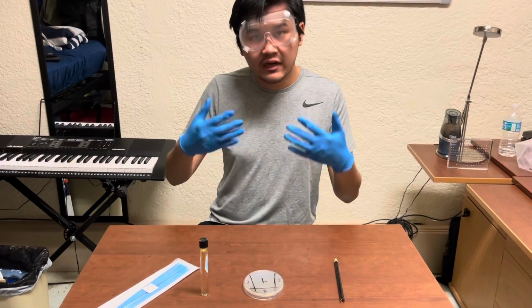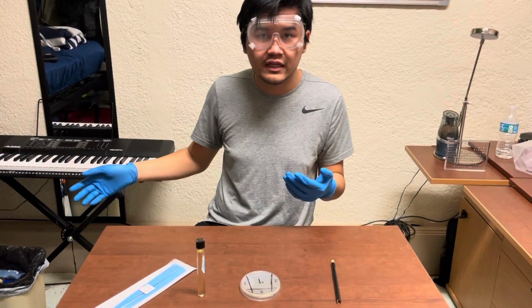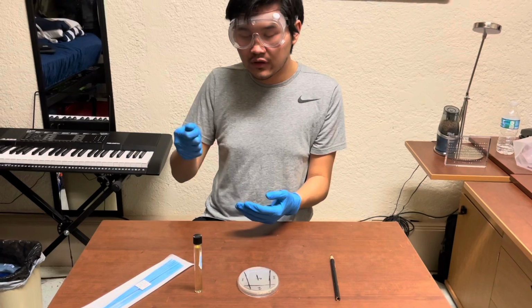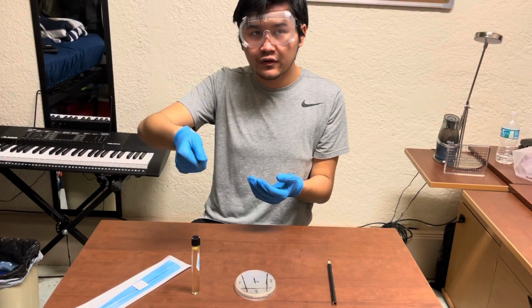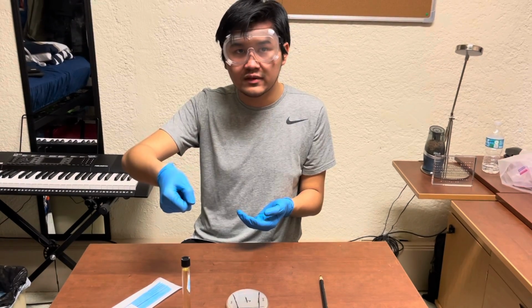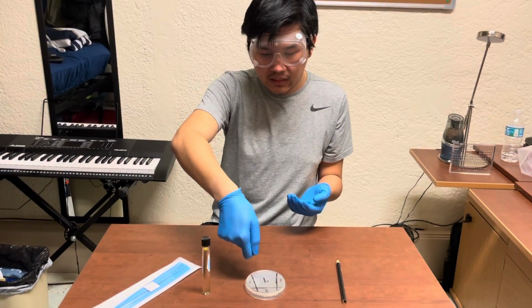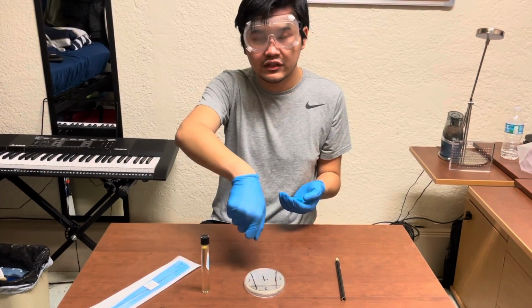If you are using a metal inoculation loop, instead of disposing of the inoculation loop that I will be doing while doing this experiment, you're going to take your metal inoculation loop, and let's pretend this is a flame for now. You're going to hold the ring part of the metal inoculation loop over an open flame, which is usually going to be lit by a Bunsen burner, for 3 to 4 seconds until it's sterile. And then before you actually streak for isolation, you're going to place your metal inoculation loop in one of the quadrants and then start your streak for isolation.